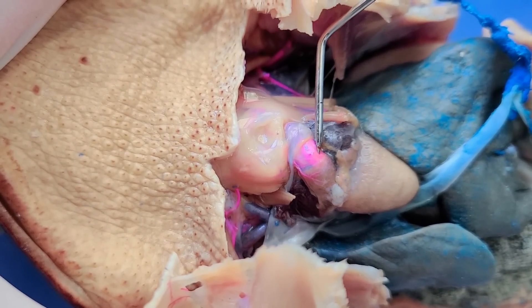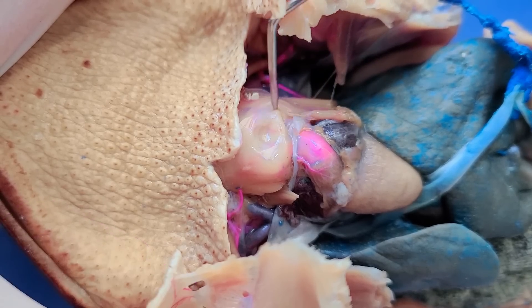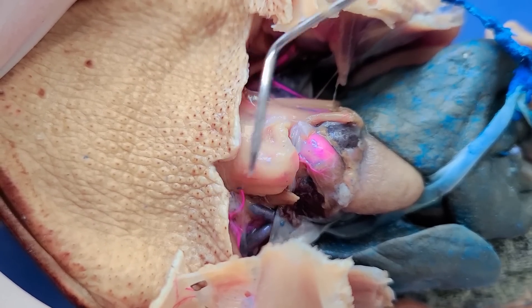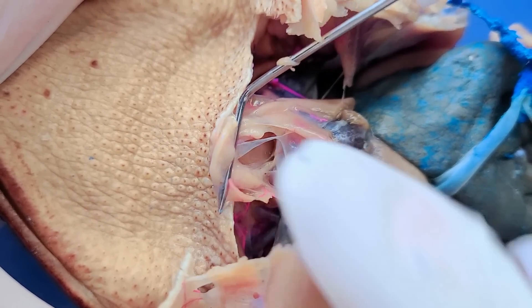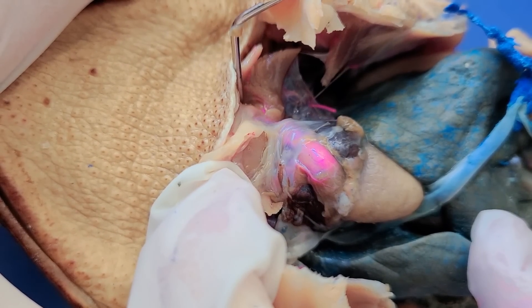You can also see, because of the injection, this pink aorta coming off from the ventricle and leading into the upper parts of the body. The aorta carries oxygenated blood from the ventricle to the other parts of the body.